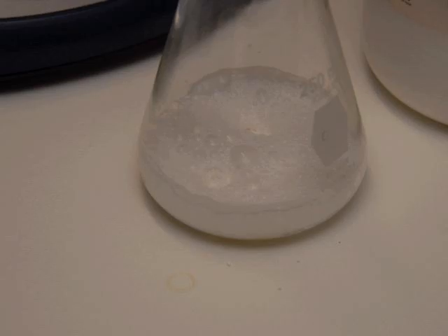So get ready with the balloon, and you'll want to put it on immediately after you put the vinegar in with the baking soda, and it's going to fizz up. It's probably going to fizz over if you have a 250 milliliter Erlenmeyer flask and you do it like I did. The carbon dioxide is going to fizz up, and it may even spill out and over the outside of the Erlenmeyer flask before you get the balloon on, but that's okay. However, you may want to do this experiment like inside some kind of shallow pan, just to prevent any spills on your table.